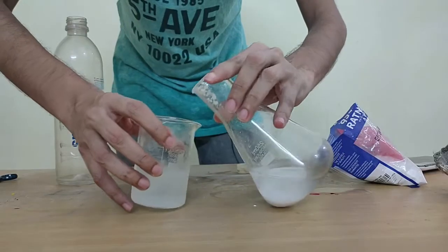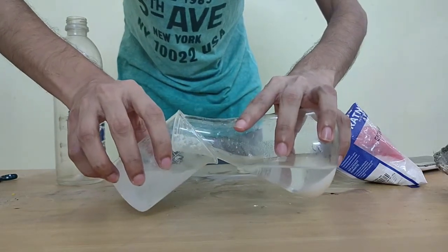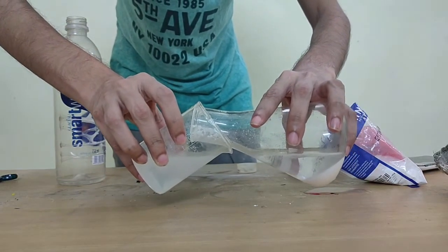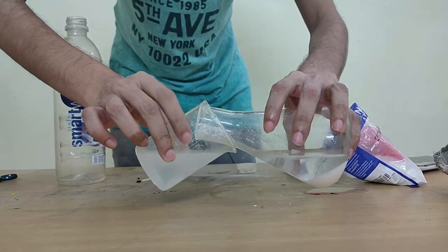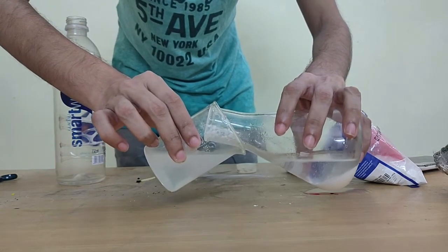I'm excited, I'm happy I was able to do this. So the best way to do it is with a delivery tube. In your reader you'll have a different setup written. Preferably use that setup, although I haven't done it here, but the result is the same, right? Whatever gas is produced passes through a tube and goes into lime water, and it again becomes milky, just like it has happened over here.